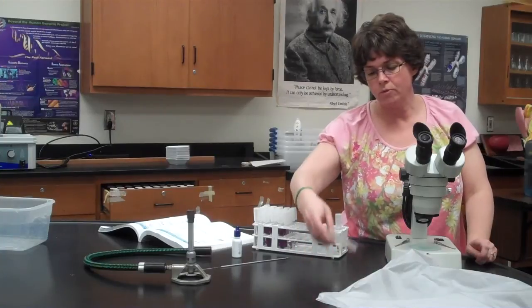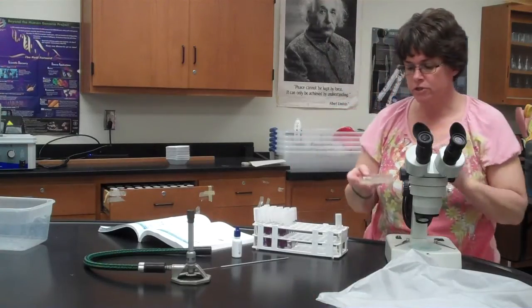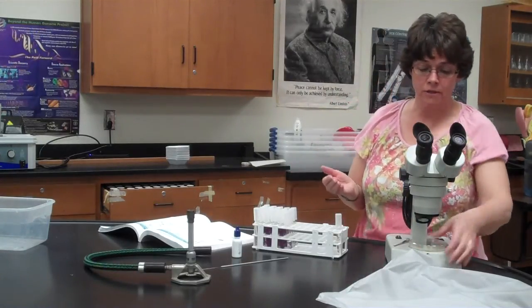One of the things to be aware of is when it does grow on the plate, you might get a lot of condensation. So you may have to look around the edges or try to work around the condensation to see it. I would not recommend opening the plate and leaving it open because these do have spores and you don't want to leave it open for a long period of time. So to get your colony characteristics, you're going to put it under here and look at it, and that's how you're going to answer that part.